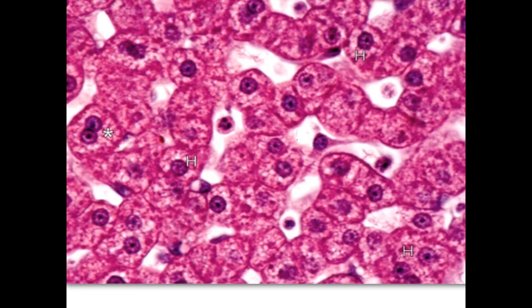We have here also the appearance of this cell. This cell here is binucleated, and this is due to the high activity of the liver cells. And also you can see here the granules inside this cell and the vacuolation. You have vacuolated cytoplasm due to dissolved glycogen during preparation of the section.